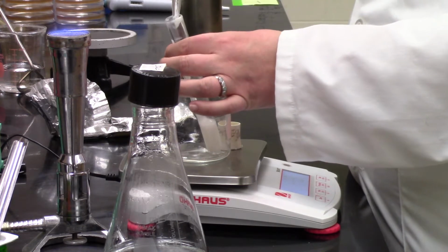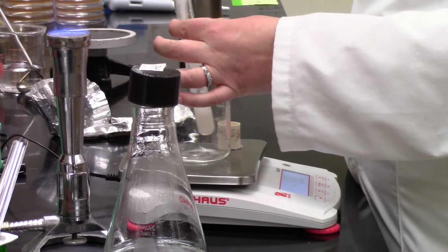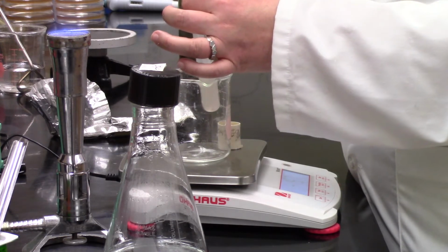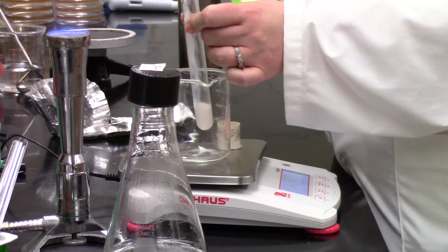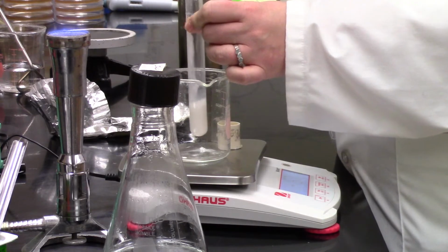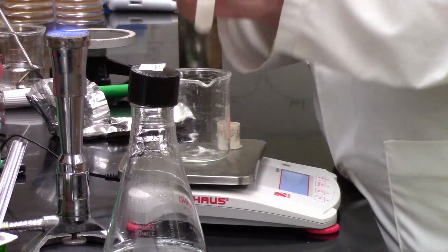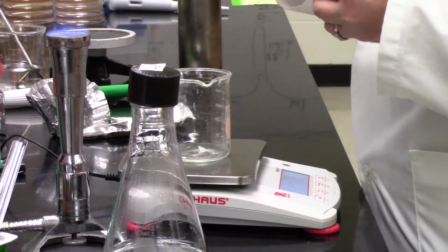It's definitely easier to do this with the capsule in terms of getting the whole contents in and not having to awkwardly try to get yogurt off the top of that. But it's always very interesting to look at yogurt, and you guys will get a nice data set at the end of this of yogurt versus a capsule to compare how many bacterial cells are actually in that 2 grams of yogurt.